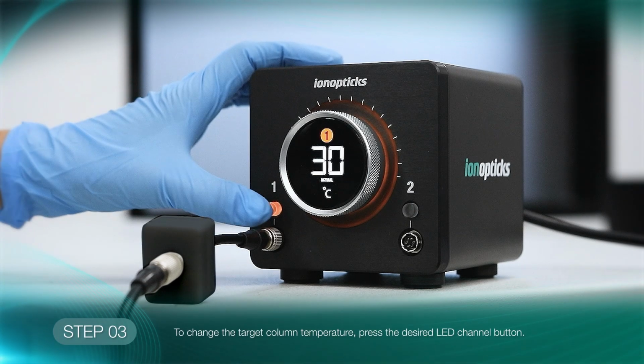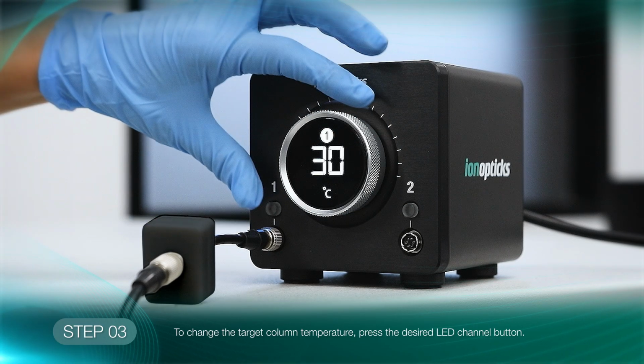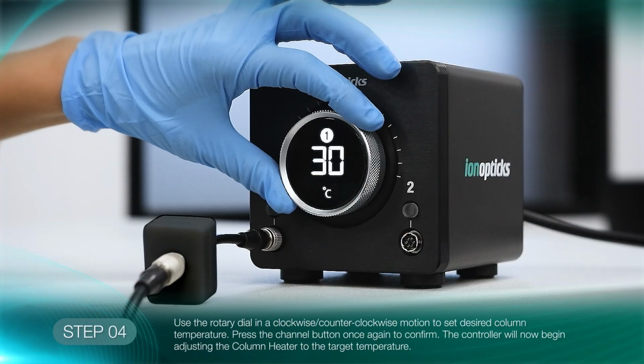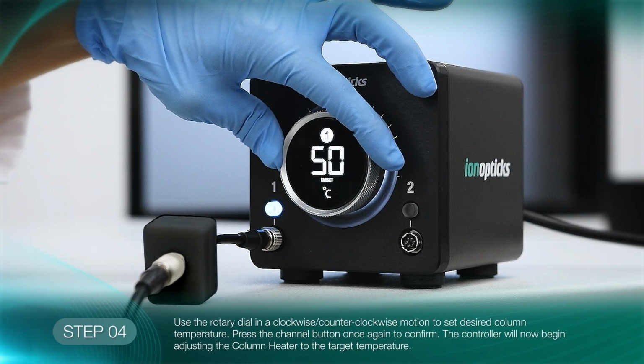Press the illuminated channel selector button to enter temperature selection mode. The channel selector button and LED light ring surrounding the rotary dial will begin flashing simultaneously to indicate the controller is ready for temperature selection. Use the rotary dial to select your desired column temperature, clockwise to increase and counterclockwise to decrease. With the use of the HeatSync regulator, a temperature delta will be applied automatically.